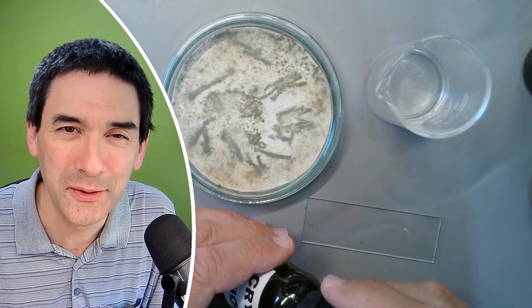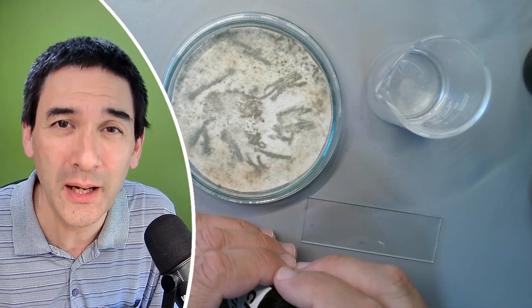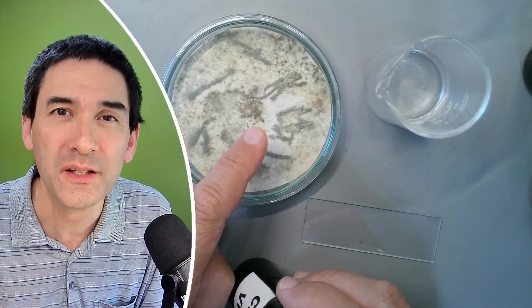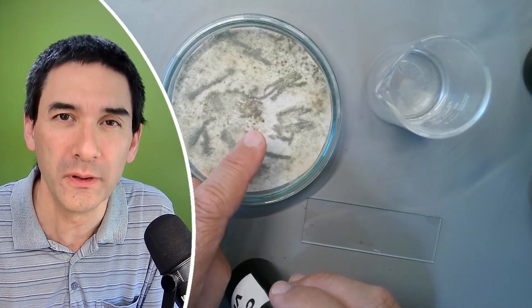So hi, hello and welcome again. Microbe Hunter here and today in this video I want to give you a short tutorial on how you can stain the spores of a mold of a fungus.